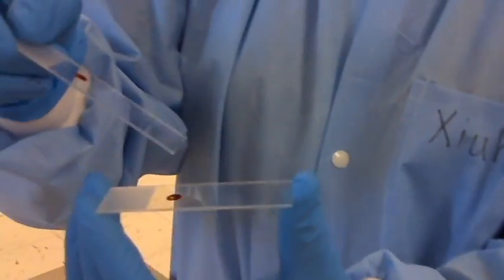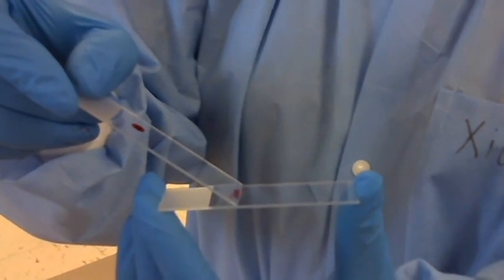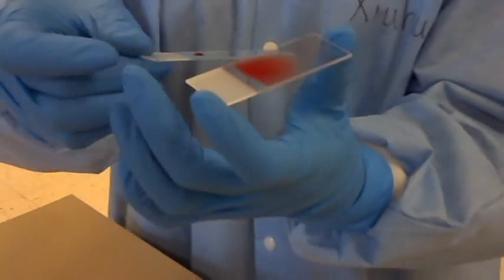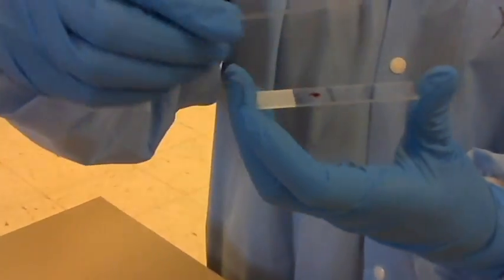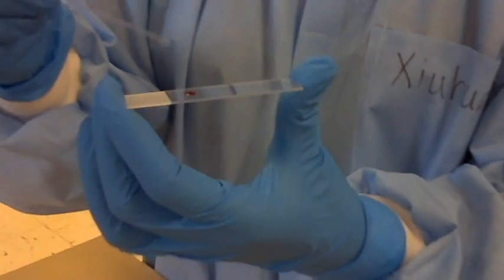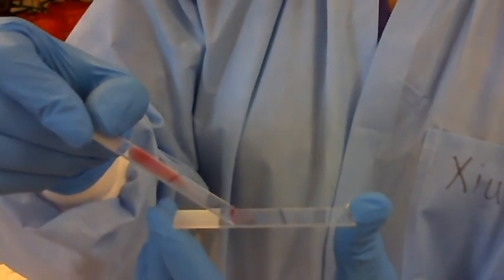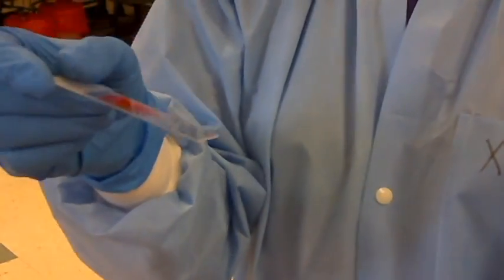Then hold like this, and this one in the right hand like this. Then pull back a little bit. This one is bad, but this one is okay — it's acceptable.